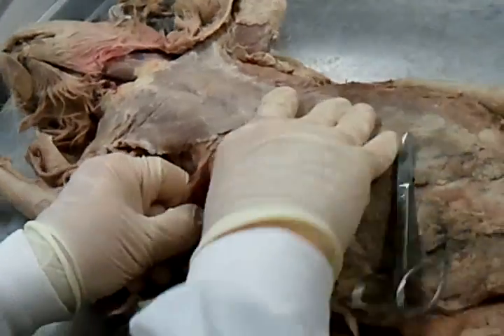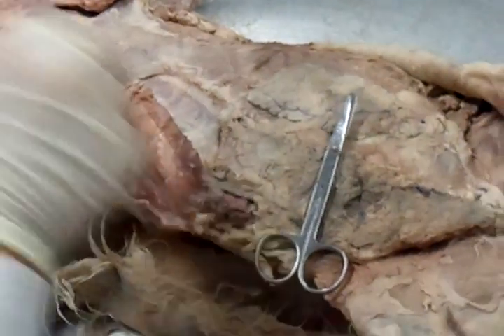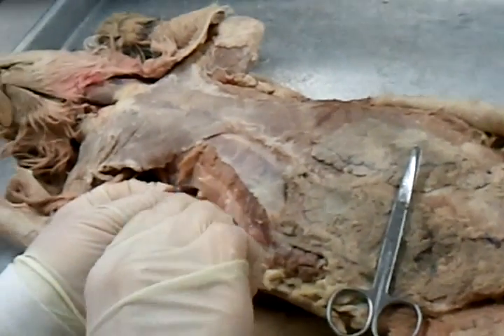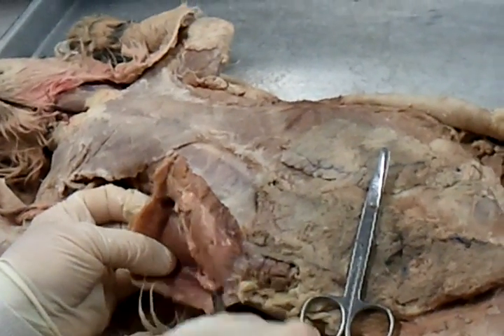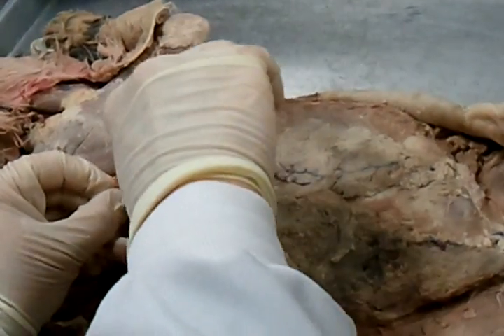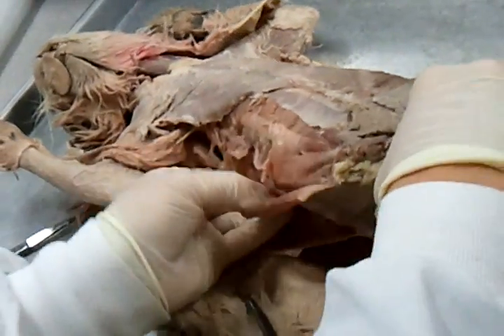I think about barbecue — you should see ribs right there. Spare ribs. Talking barbecue? You guys are scary — marinated cats. I've never heard that before. These are preserved cats. Is that fat? Yeah, that's fat. This is a fatty cat. Well, she's pregnant — I think she's pregnant.